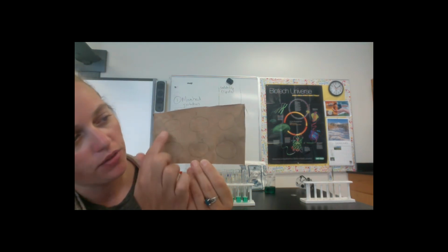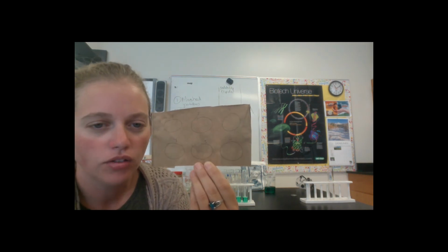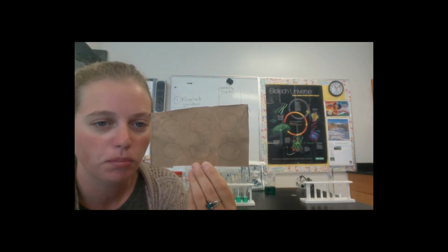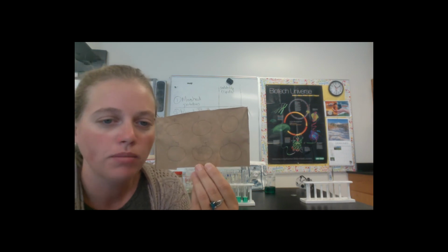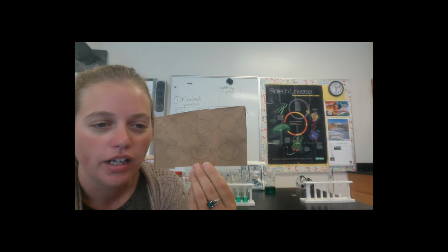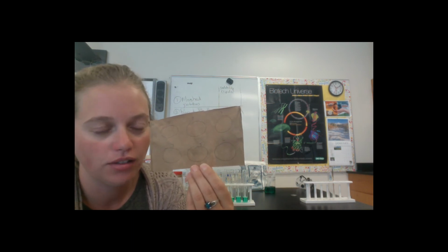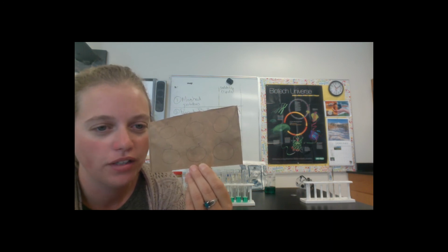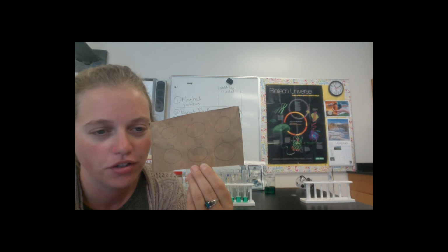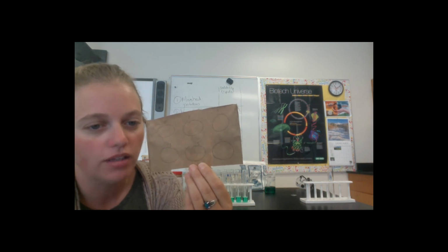So you can see that I've gone through and I have drawn circles and put numbers above each circle. The circle is to indicate where I put the spot, and the number is to indicate which food went into the spot. So what I'm going to be looking for is a greasy spot to be left in this circle after this dries. So I'm not actually going to let this dry and show you on this video, but I will post this picture to Canvas so that you can see which of our foods do have lipids in them. But I will show you how to run the spot test.